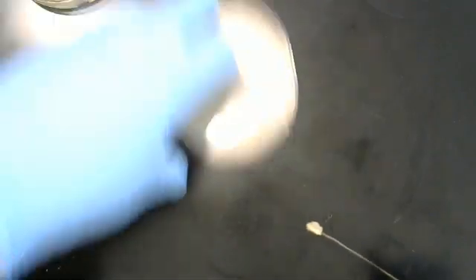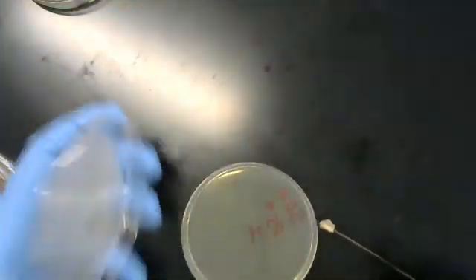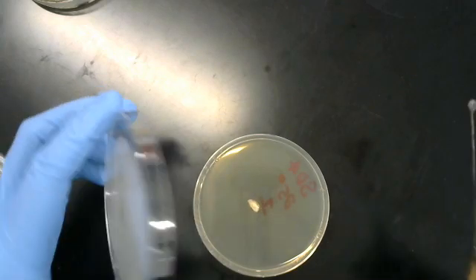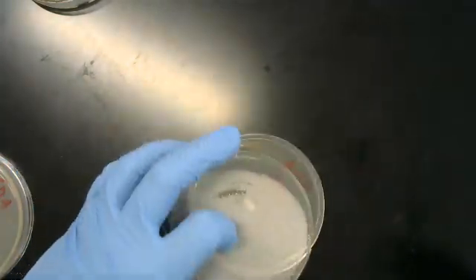And we're going to take this, add it to our plate, our number one plate. Place it right in the center and store it like that, incubate it for a week.